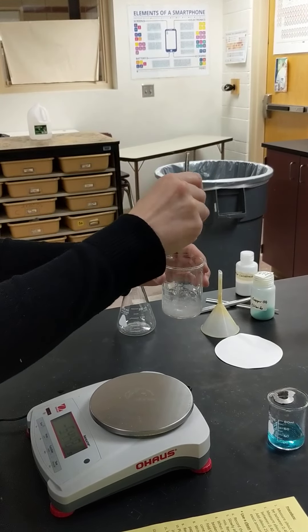So that looks good there. So you can see those observations of what those were. What we're doing here is we're filling in your data table for the chemical formula. You should have the masses and then your observations of what the sodium carbonate looks like and what the copper chloride looks like.